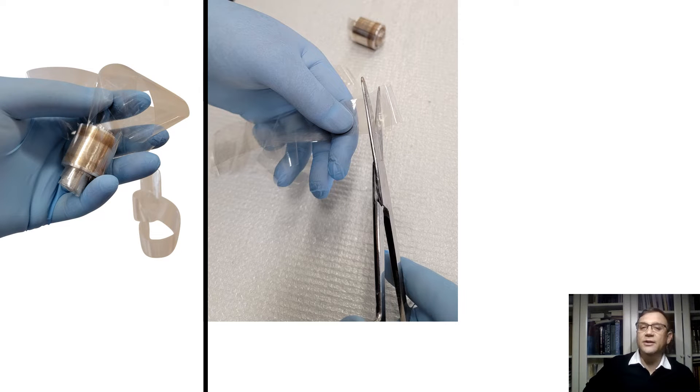Cut a piece of dialysis tubing to 13-15 cm. Ensure that the length is sufficient to hold our sample with extra room for tying the ends. In our experiment, we will use 10 ml of sample solution in each bag.